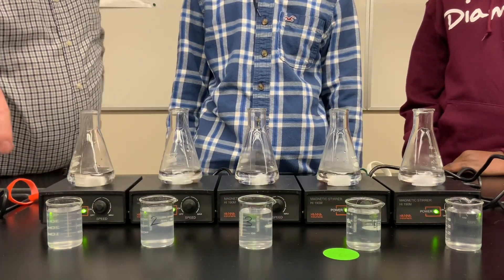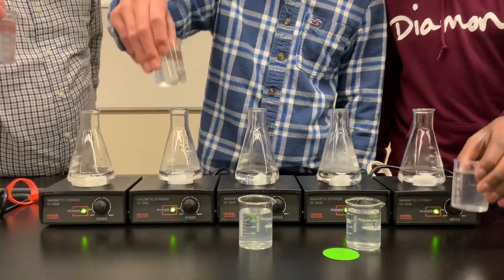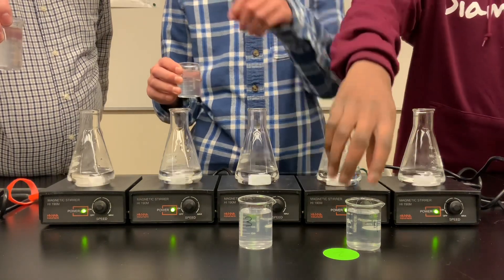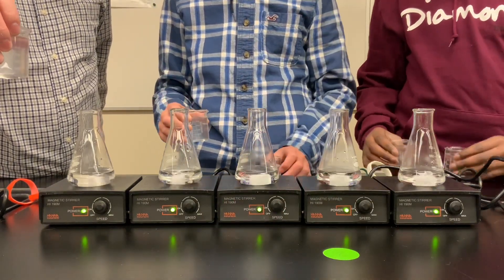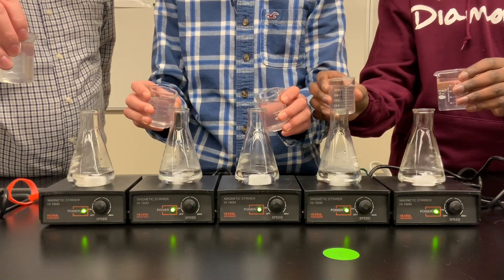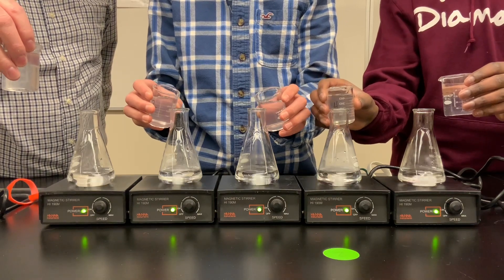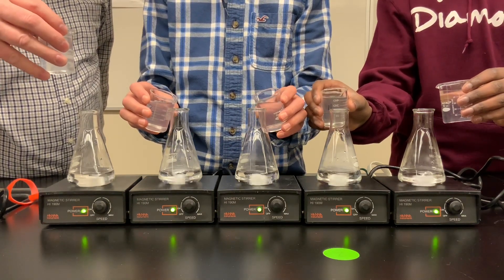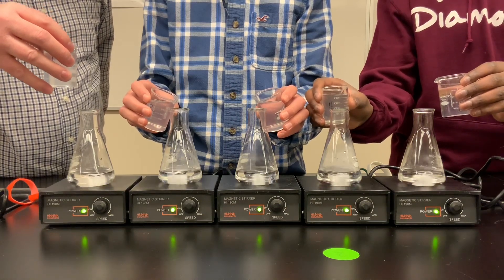Two volunteers are going to grab their beakers and pour them into the flasks at the same time. We're going to pour them quickly into the flasks when I count down. As soon as we pour them in, if you're watching at home, you can start timing the reactions. I'll give a three-second countdown, and when I say go, we'll pour in the chemicals.